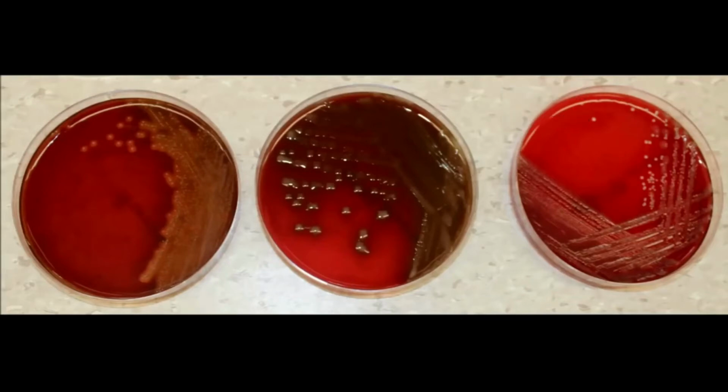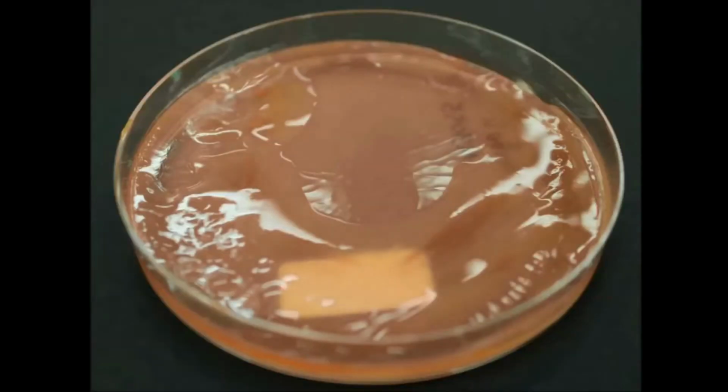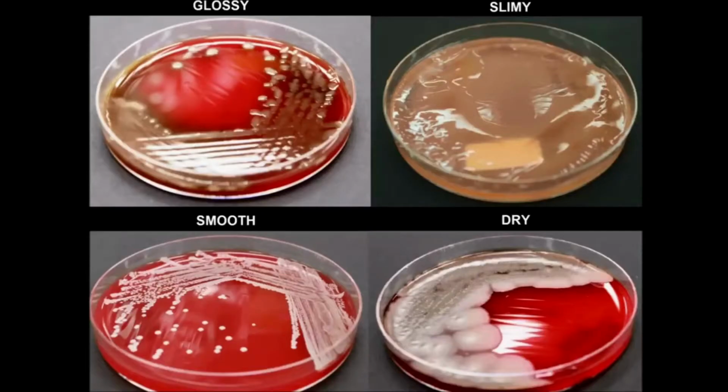The appearance of these colonies is termed colony morphology. Describing colony morphology is the first part of identifying and characterizing a bacterial culture, because individual bacterial species often form colonies of characteristic size and appearance. The four main characteristics we use to describe bacterial colonies are size, shape, colour, and any other distinguishing features, such as whether the colony surface is glossy, slimy, smooth, or dry.